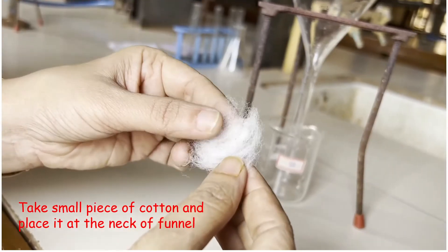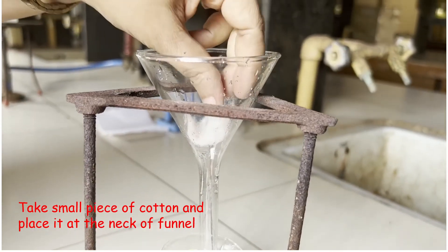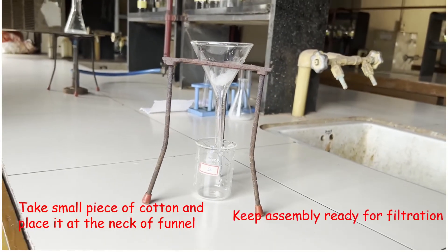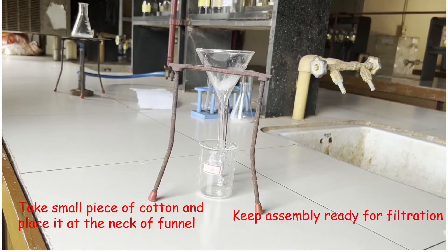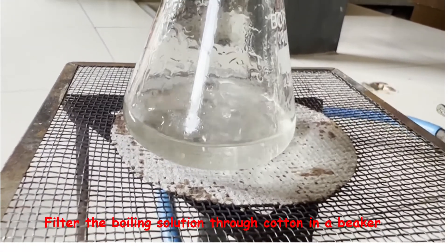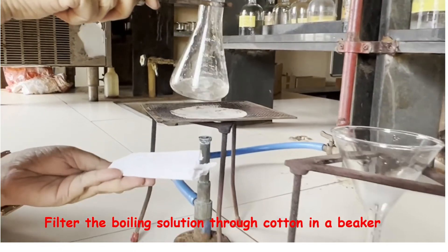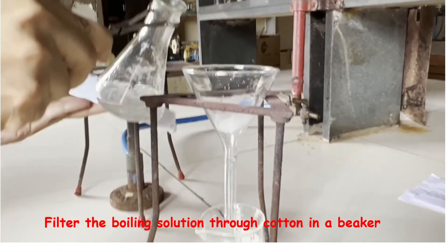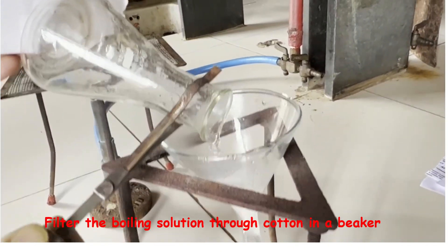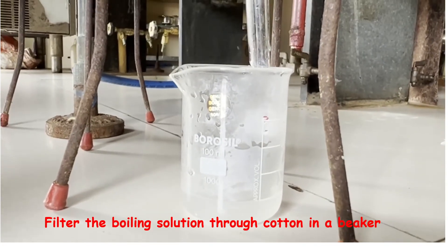Meanwhile, take a small piece of cotton, spread it properly, and keep it at the neck of the funnel. Keep this filtration assembly ready for filtration. Once your solution starts boiling, you have to filter this solution through cotton. This filtered solution will get collected in a 100 cm³ beaker.